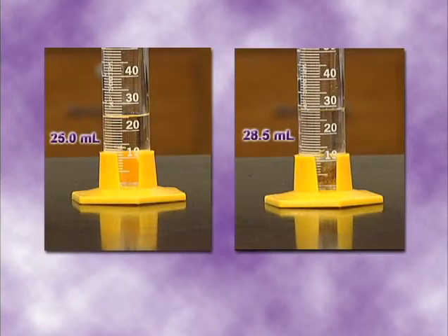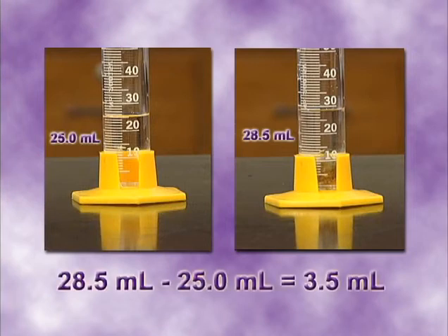The volume of water in the graduated cylinder before the rock is added is 25.0 milliliters. After the rock is dropped in, the volume is 28.5 milliliters. So you subtract 25.0 from 28.5 to get 3.5 milliliters as the volume of the rock.